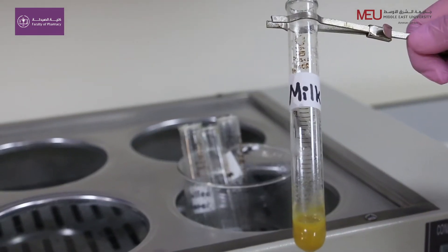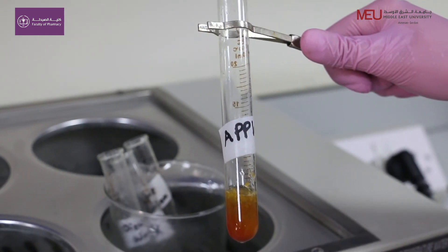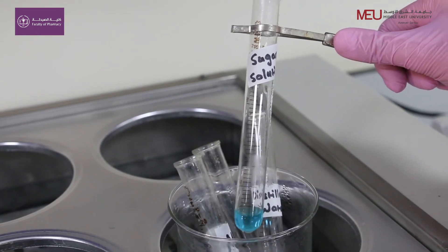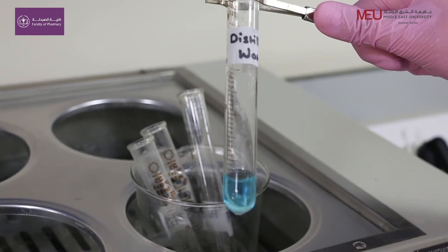A reddish-orange solution indicates an abundance of reducing sugars. If the solution contains sucrose, a non-reducing sugar, there is no change in color and the solution remains blue.